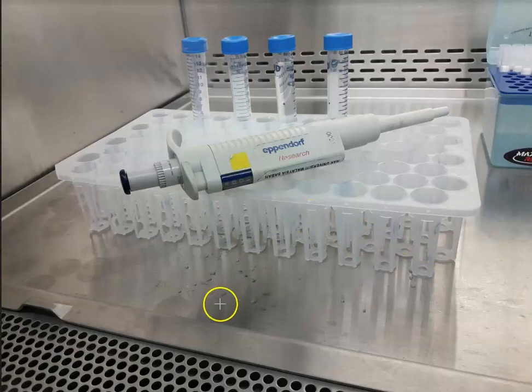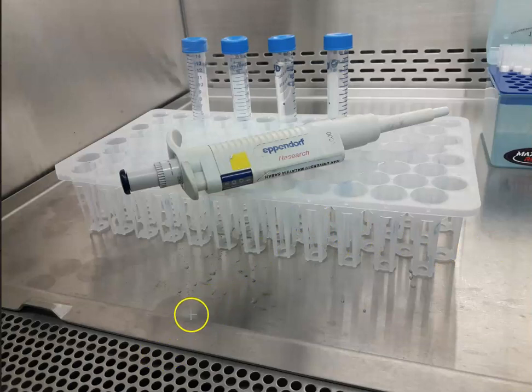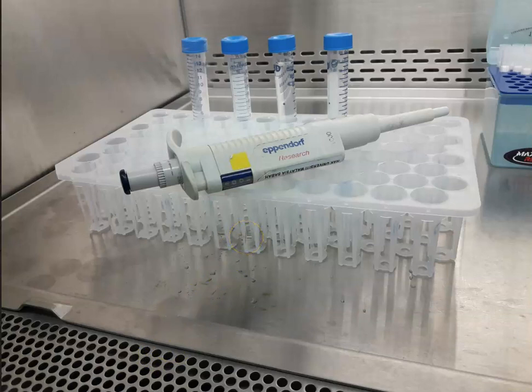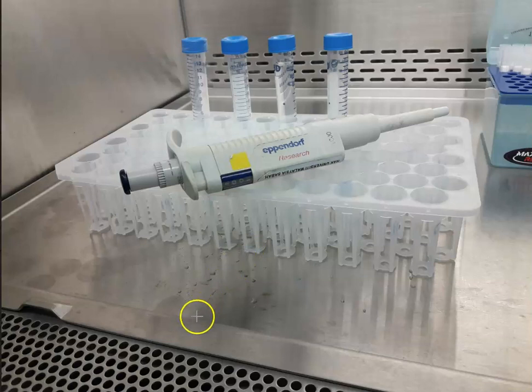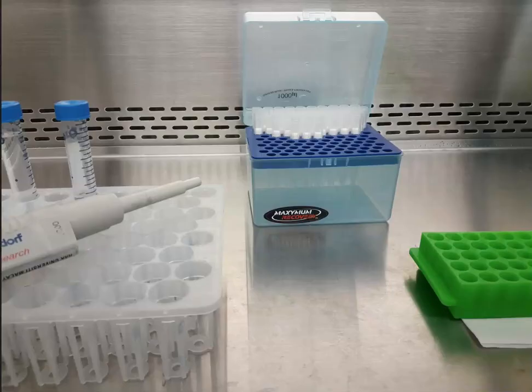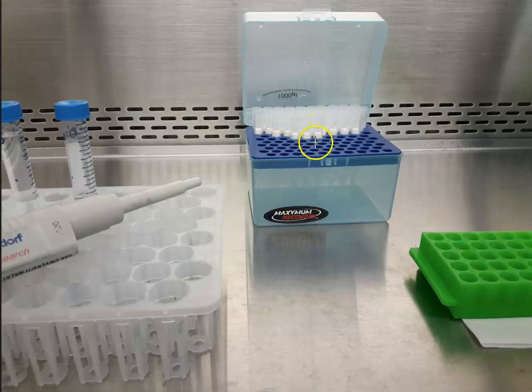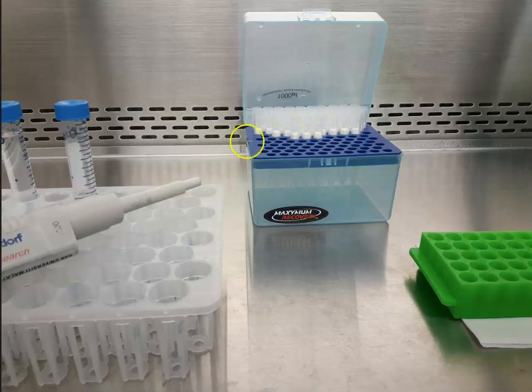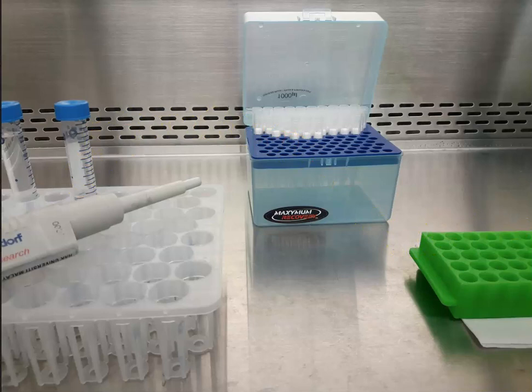This is a closer layout of the rack. A distance of around 10 centimeters has been maintained between the grill and the samples in order to ensure there is no interchange or contamination of this space. This is where you place your tips — this is a clean area; the tips are sterilized. You retrieve the tip with the pipette and can then transfer the sample into the respective tubes.